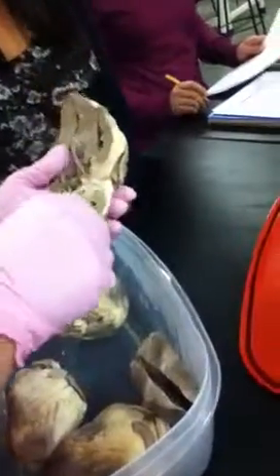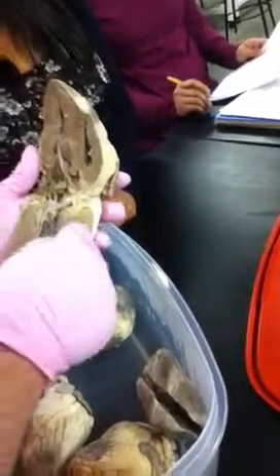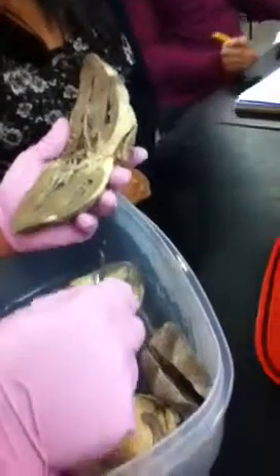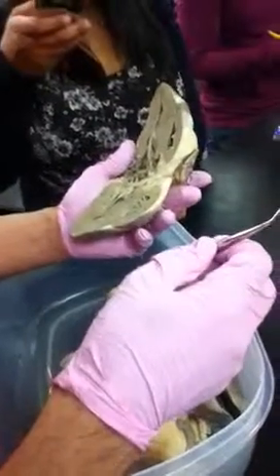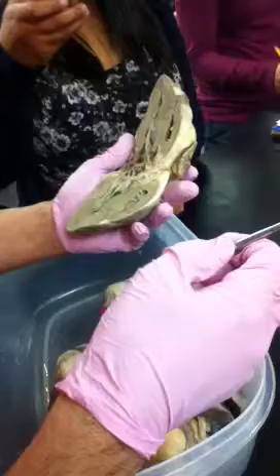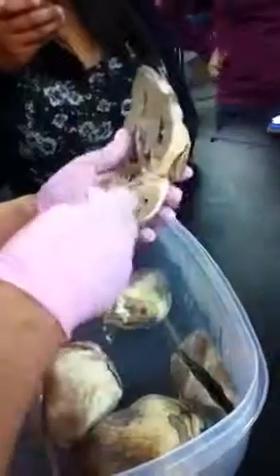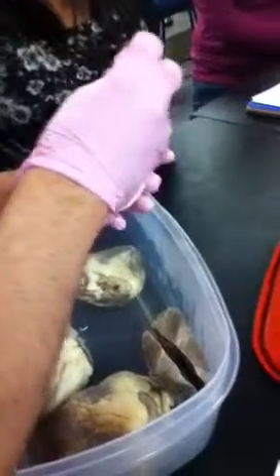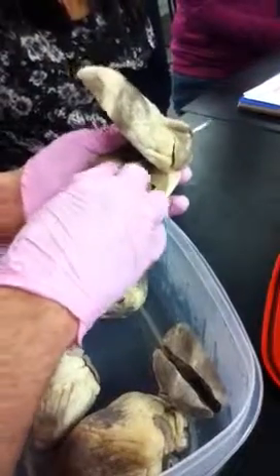So, chordae tendineae, and again, if it's up on a cusp, it's going to be a valve, an AV valve. Right, and remember, aortic and semilunar are going to be in the book. And the way that we're going to identify which vessels is which hole it's going into. So, if it's going into this hole right here, well, we can find it, right? If the probe is sticking clearly down here, it's the aorta.